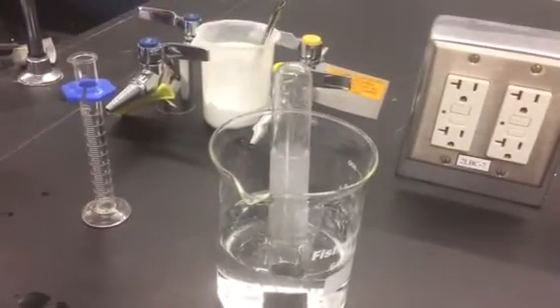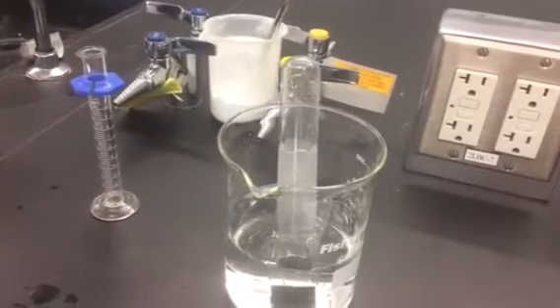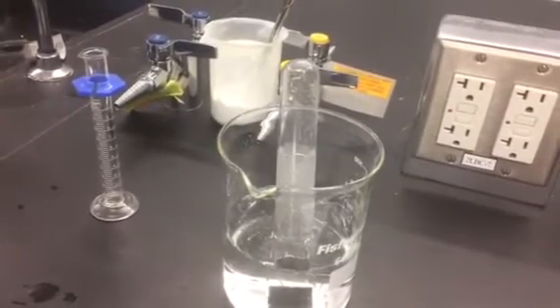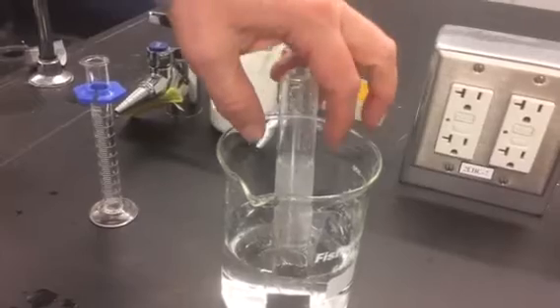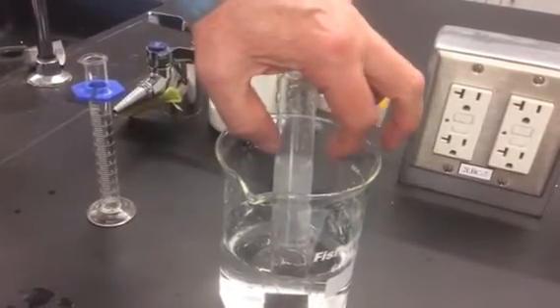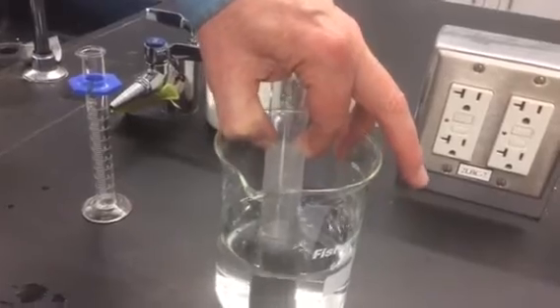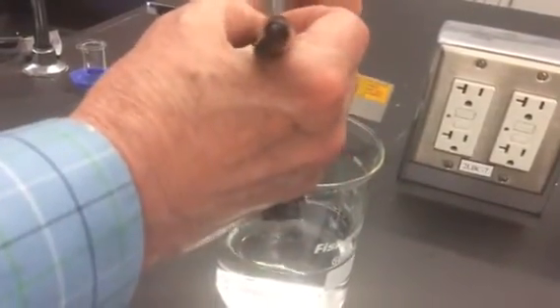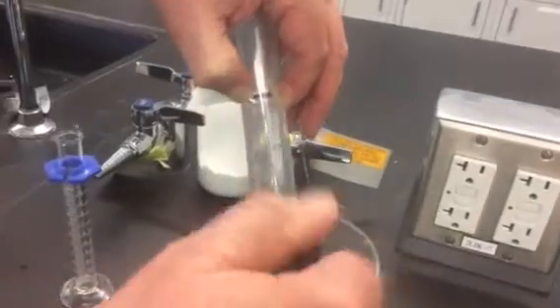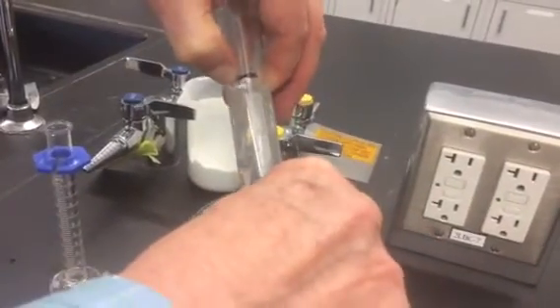And then as you pull it out of there, transfer that thumb mark to a mark using a sharpie. I'm just going to pull it out right now before it's done just to illustrate the principle. So I'm putting my thumb right on the volume and then I'm going to go ahead and use the sharpie to mark it. And then although it's not completely reacted yet, I'm going to dump out the reaction mixture.